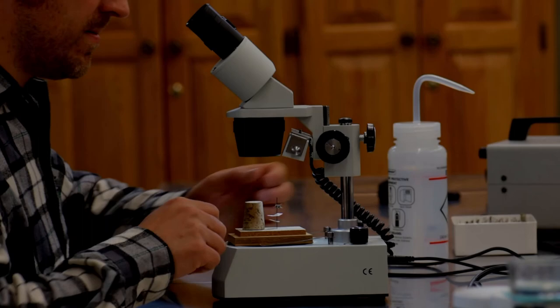Microscopes are a great tool for identifying insects because they allow you to see parts of the insects that you can't see with a naked eye.